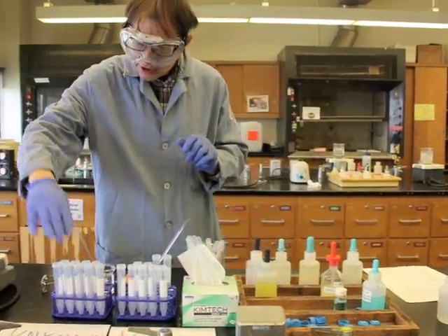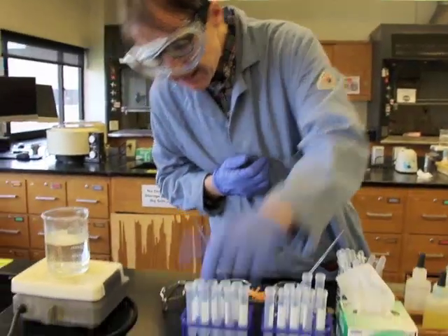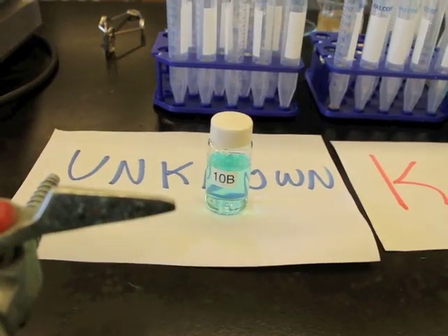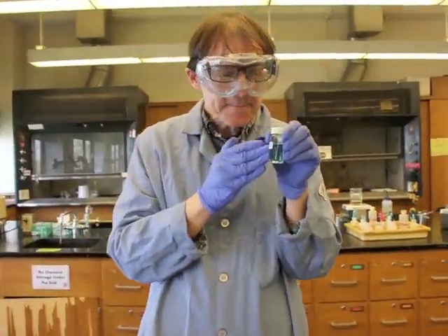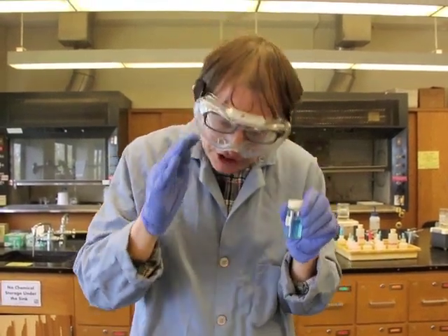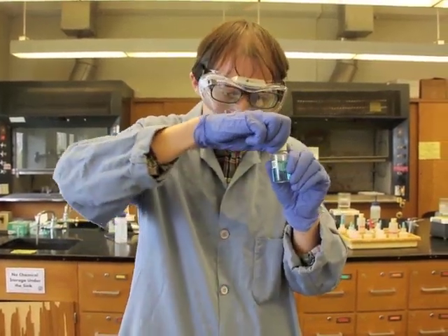Now over here, I have the unknown solution. So what I'm going to do is take this unknown, which is number 10B. And we're going to analyze this unknown at essentially the same time as we analyze the known. This solution might have all 4 ions in it, or it might only have 3 or 2. We're not sure. We're going to use our analysis of the known and compare it to the unknown to figure out which ions are actually in this solution.